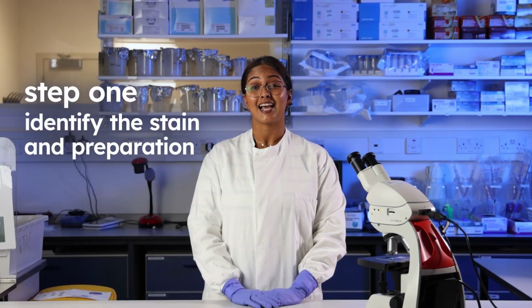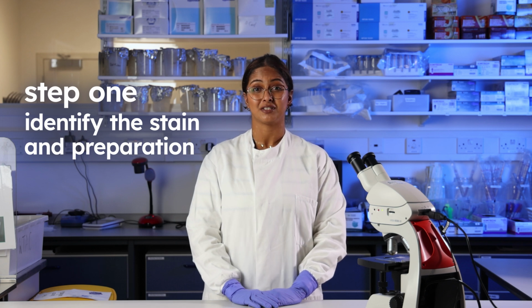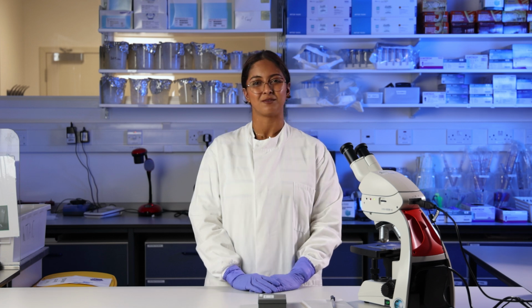We'll be looking at a histology slide, or a slide with tissue cells on it, specifically an earthworm. Different stains highlight different structures within the tissue cell, which is really important when we want to look at them. But they can also totally change how the tissue looks. Knowing what dyes were used helps you figure out whether something is actually blue or just stained blue.